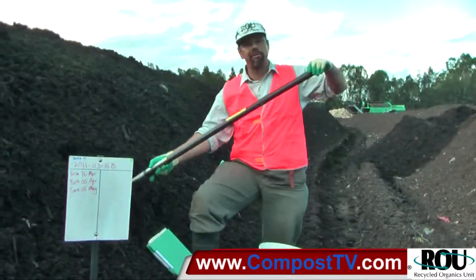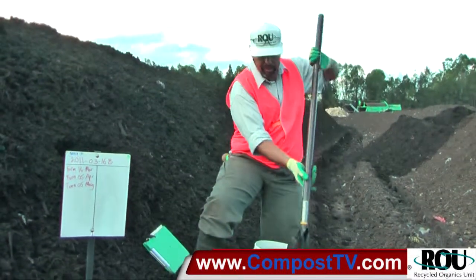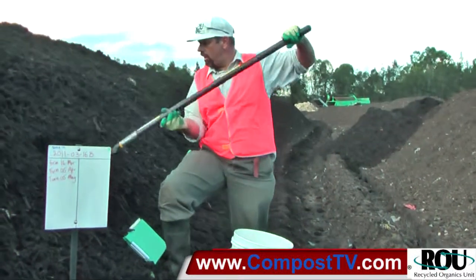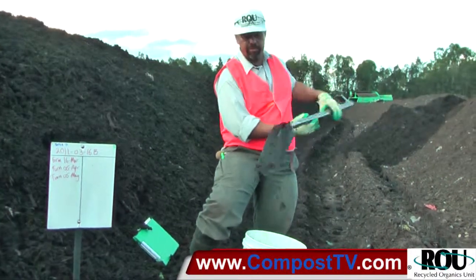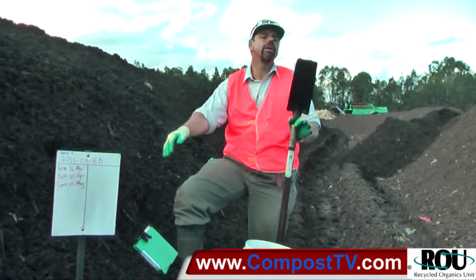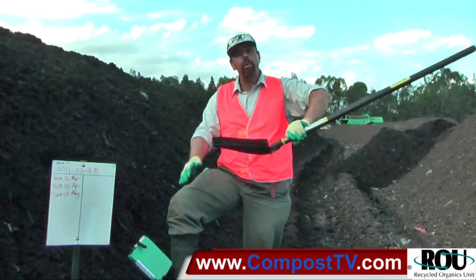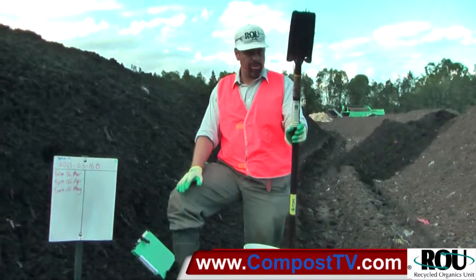Because this is a nominal 50mm-minus grind, for each incremental sample at each sampling point we need a minimum of four litres, so as not to miss out on the full mix of particles. I like to use a trenching shovel, which allows me to get something in the order of one to two litres per shovel load. A nice flat level shovel full is about one litre, and a heaped shovel will get me one and a half to two litres. So I can keep track of how much material I'm getting just because of the tool I've used.